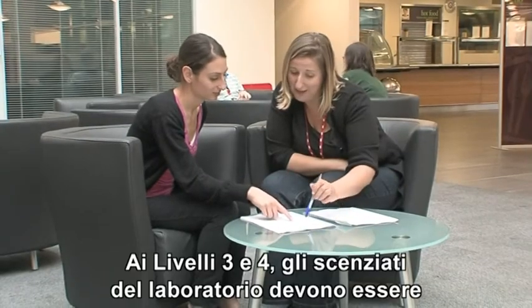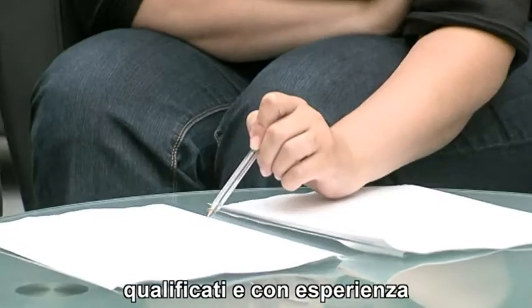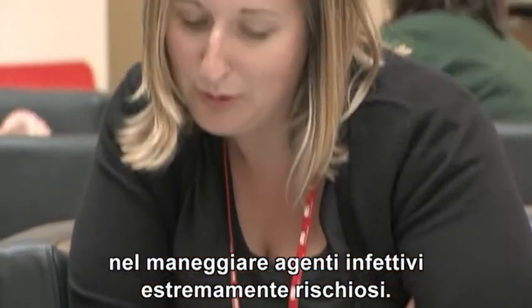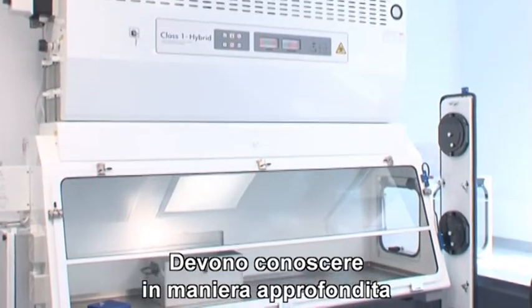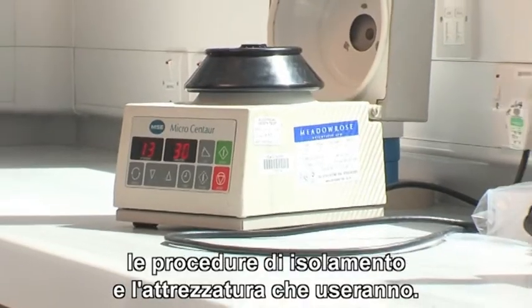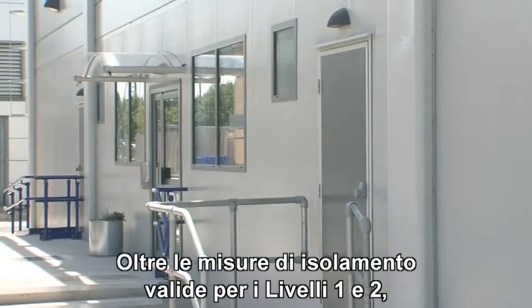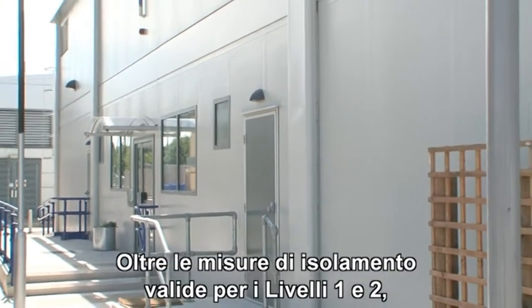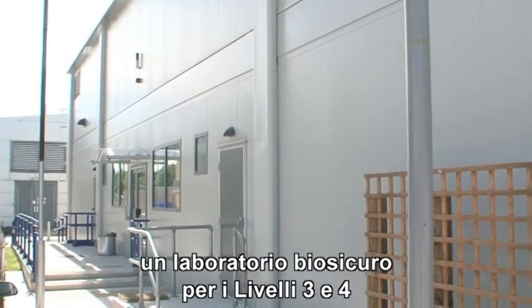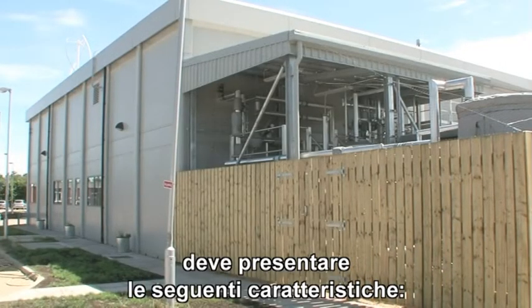At levels 3 and 4, laboratory scientists must be qualified, trained and experienced in the handling of extremely hazardous infectious agents. They must have a thorough understanding of the containment procedures and the equipment they will be using. In addition to the containment measures set out in levels 1 and 2, a biosafe laboratory for levels 3 and 4 will also include the following features.